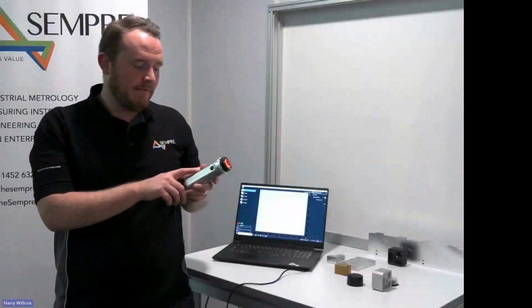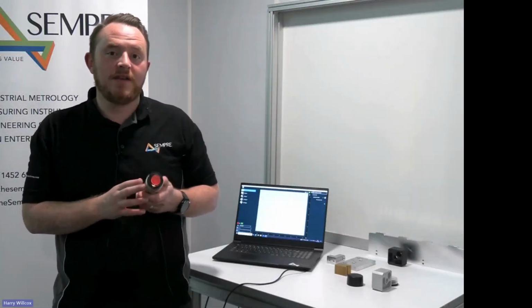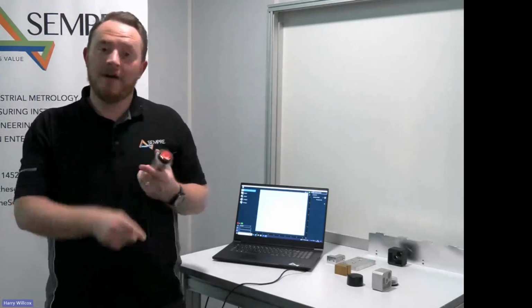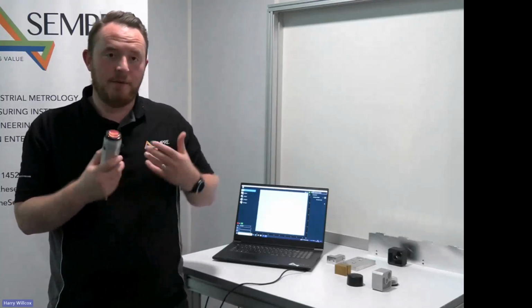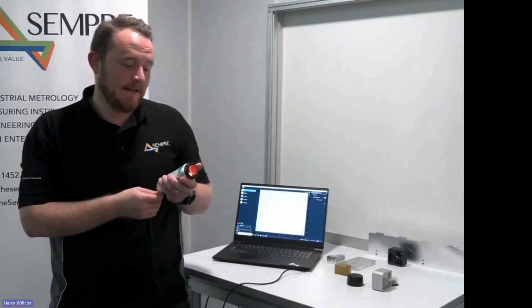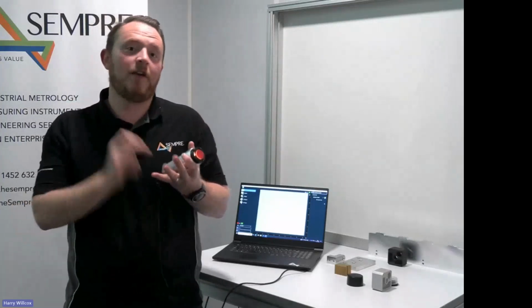So here we have the Gelsight Mobile Series 2 system. The Gelsight is used to characterize surfaces. Whether that be a surface defect, surface roughness, a radius, a chamfer, a break edge, or hole diameter, the system is used to characterize those kinds of features and give us a report or a template to capture that information, so that we've got traceable data to suit the current industry standards within aerospace, automotive, and high precision machining.